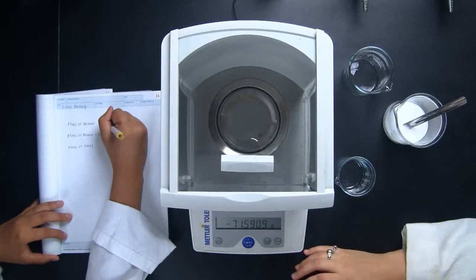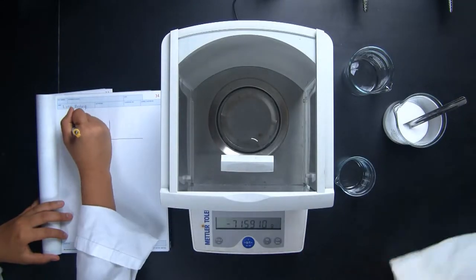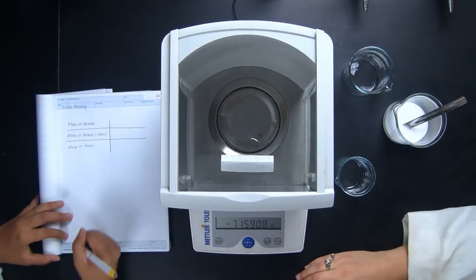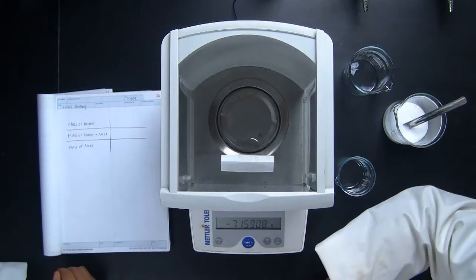Wendy is a conscientious student. Notice that she is preparing a table to record her data ahead of time. She has read the lab manual and is ready to go.